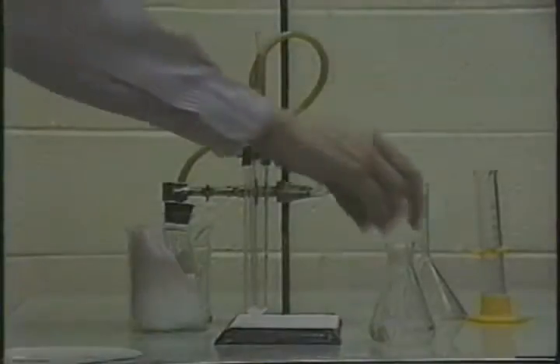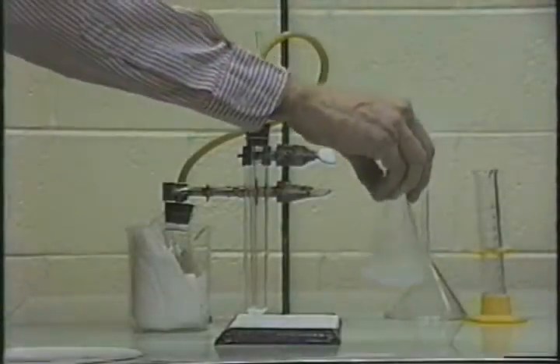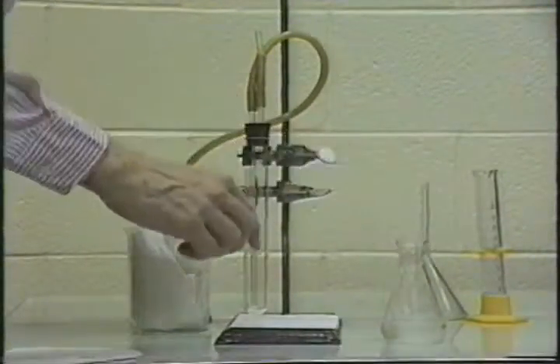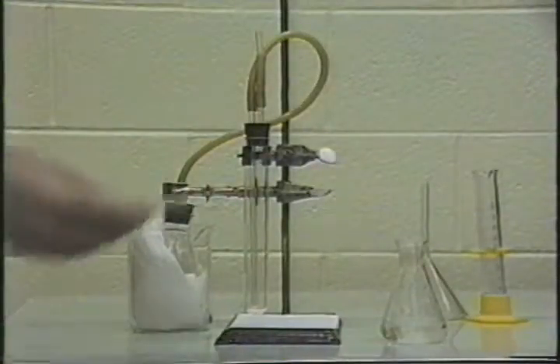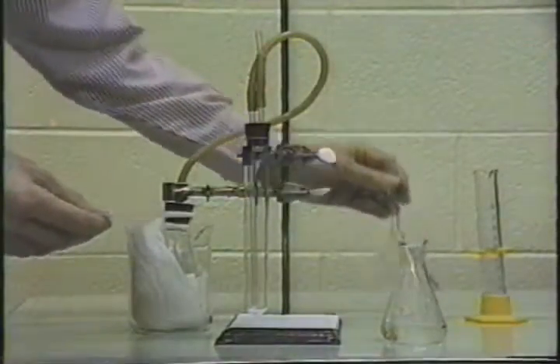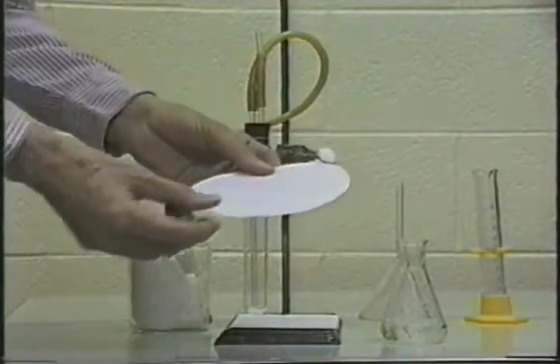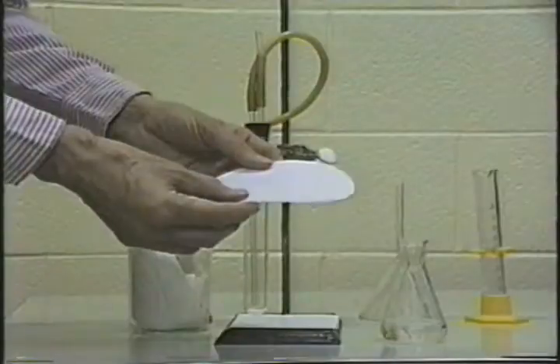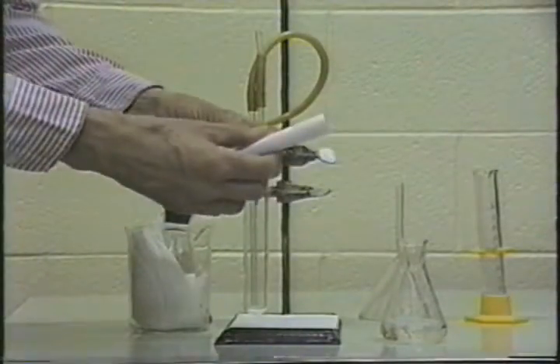There. At this point, we used our salt to saturate the ammonia solution, and now we're going to filter the ammonia solution into our reactor. To do that, we'll use a piece of filter paper and the funnel, but first we must fold the filter paper. Now, to fold a piece of filter paper to fit one of those funnels, what you do is you fold it in half.